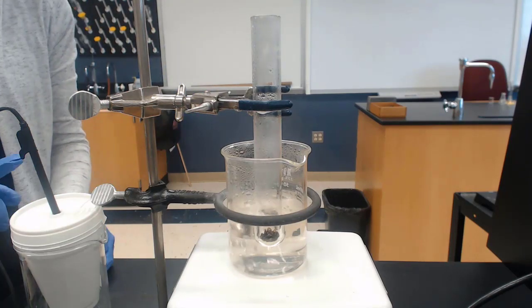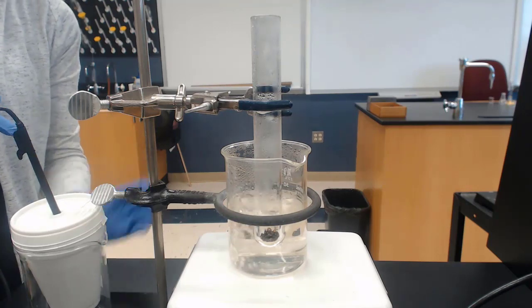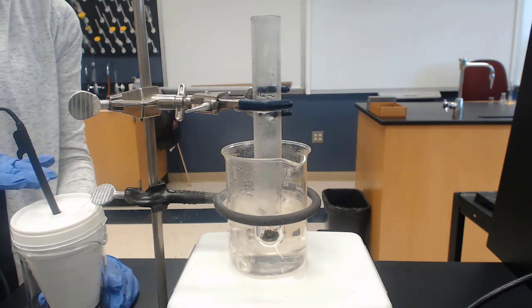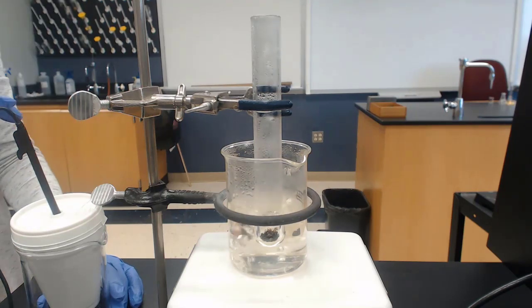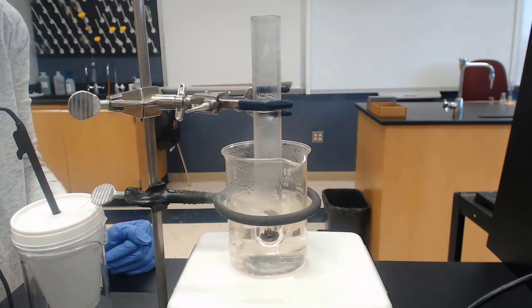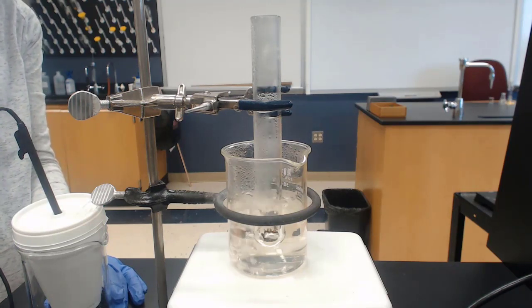The initial temperature of the water will come from our graph because the temperature probe is in the water, in the calorimeter. So I will be transferring the hot metal to the water. The water is starting around room temperature, so we will be able to get the temperature of the water from the graph. And I'll be putting over the metal and starting the graph. The graph's temperature will rise. So I'll begin the graph. It's plateauing with the initial temperature of the water in the calorimeter.